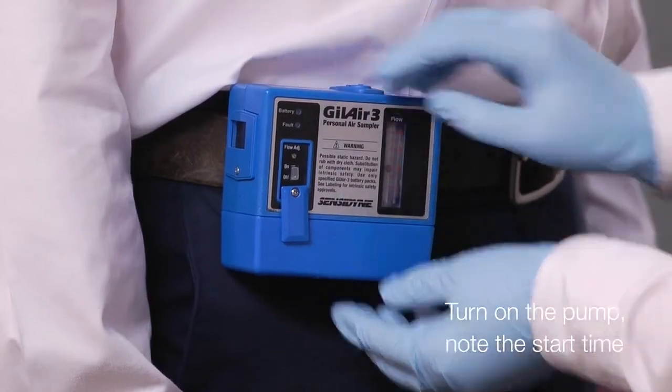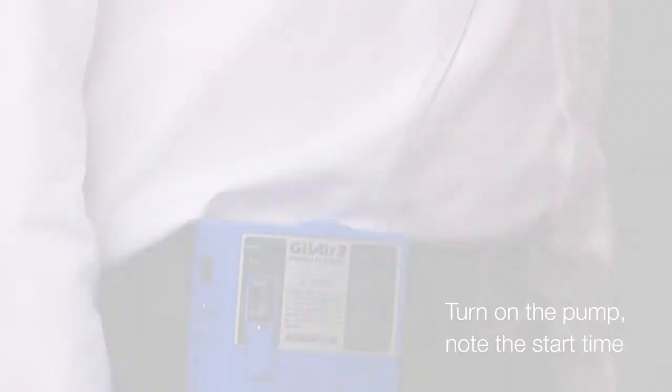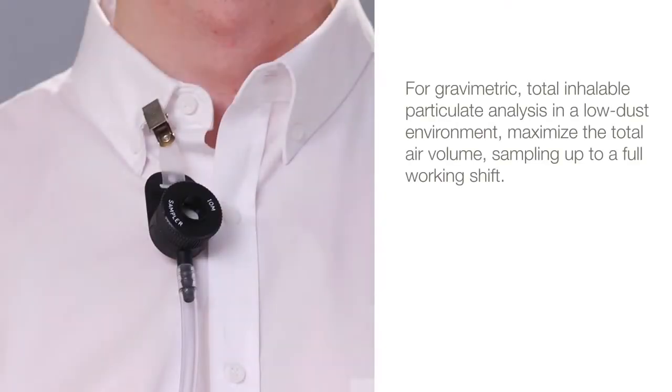Turn on the pump, noting the start time. For gravimetric, total inhalable particulate analysis in a low-dust environment, maximize the total air volume, sampling up to a full working shift.